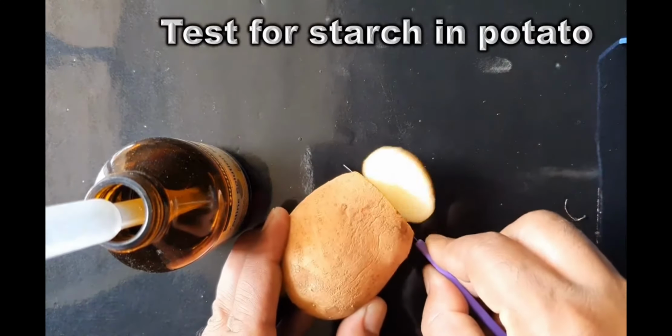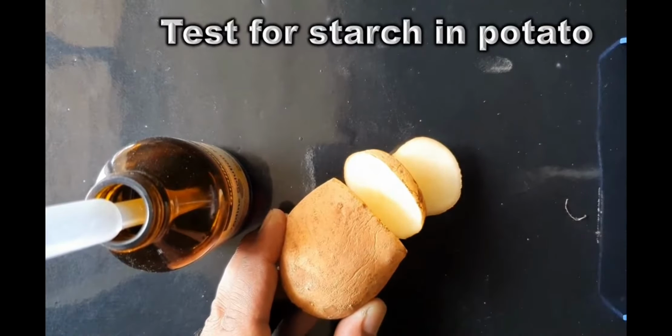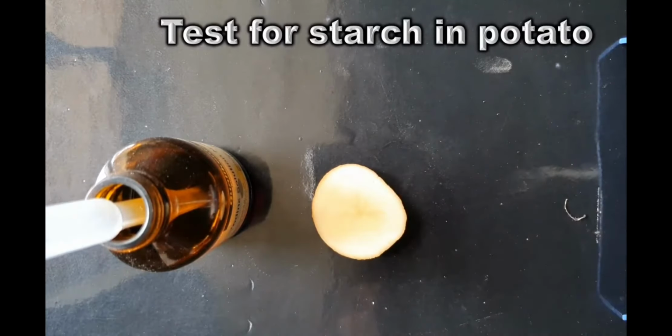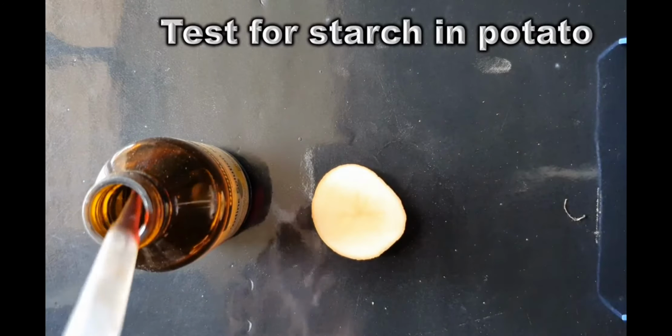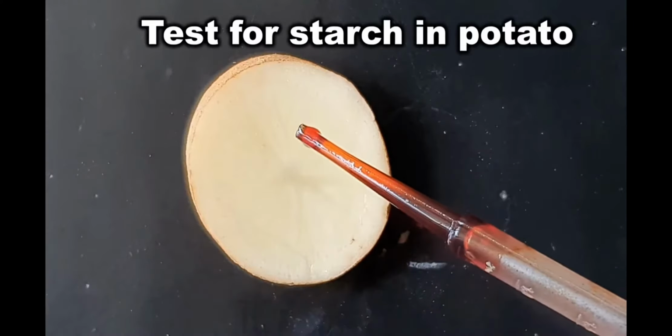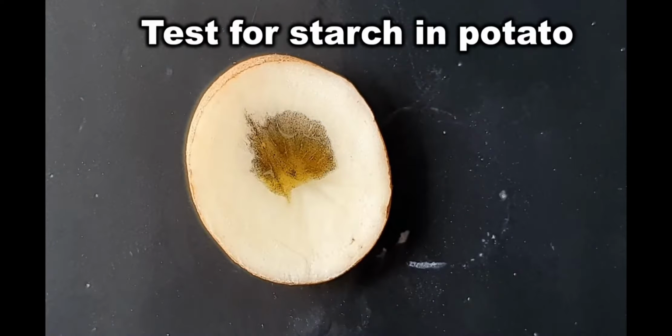Similarly, we will take a potato and then test it for starch. Now taking a piece of potato, we will add a small amount of iodine solution using a dropper. Please observe carefully what happens. You can observe that the potato is slowly turning into blue black color, right? So this indicates the presence of starch in the potato.